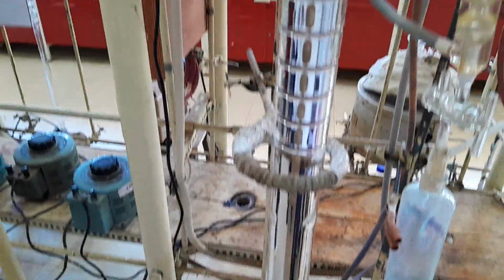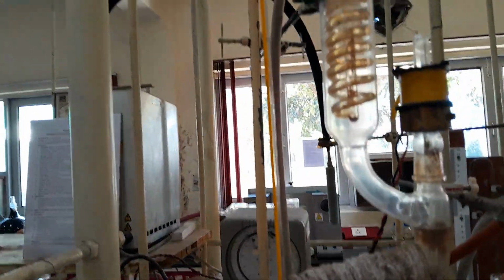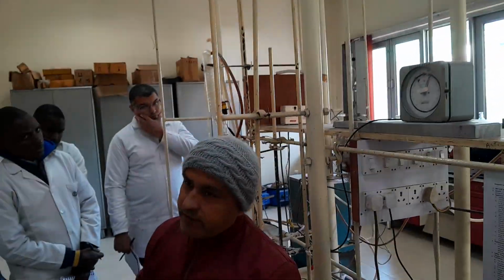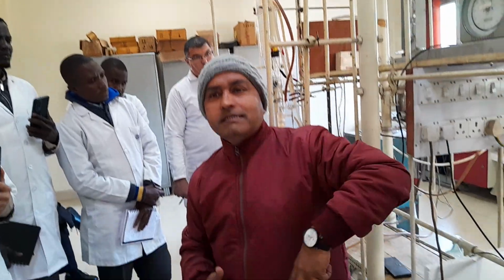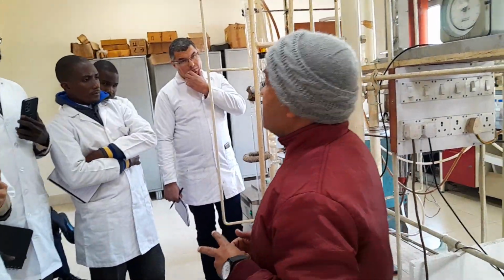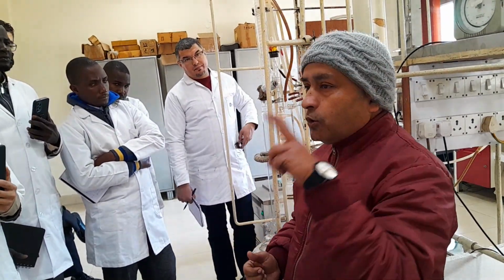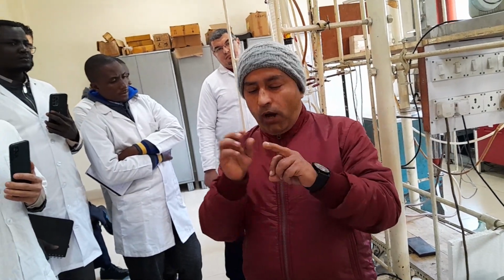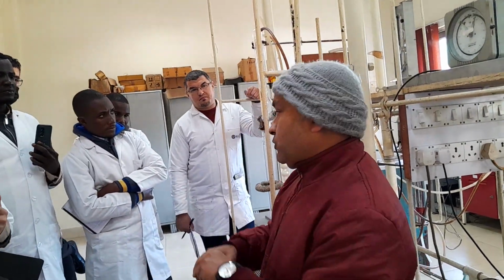As we know, there are three types of distillation. One, fractional distillation. Second, semi-fractional distillation, and simple distillation, or non-fractional distillation. Now the question is arising: what is required for fractional distillation? See, two things are very, very important for fractional distillation. One, interaction media, and second, reflux media. If one of them is absent, then it is semi-fractionating. If both of them are absent, then it is non-fractional distillation. So crude oil has to be distilled by fractional distillation.